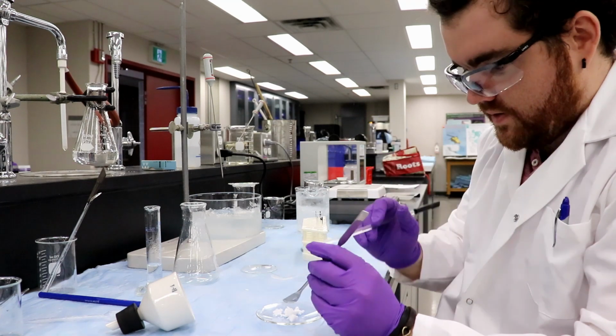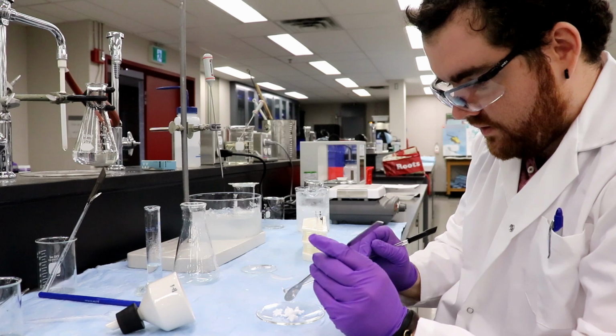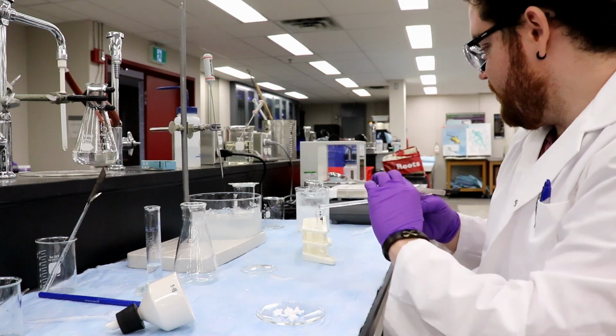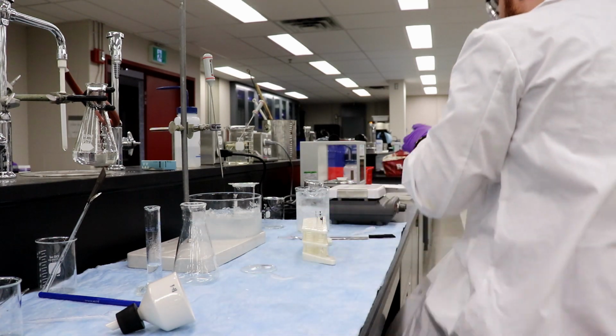Okay, use this to get some of those off. They're looking pretty good. Very fluffy. Do you want anything else to help you with that or not? I think we should be good. There's only so much you can do. Yeah. I think that's a pretty good job. Okay, now in the oven they go?